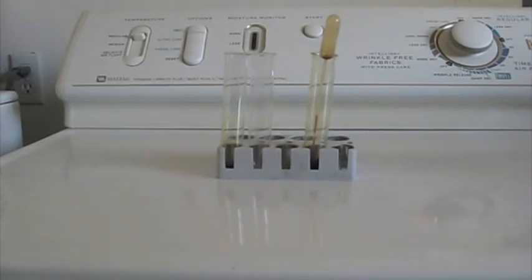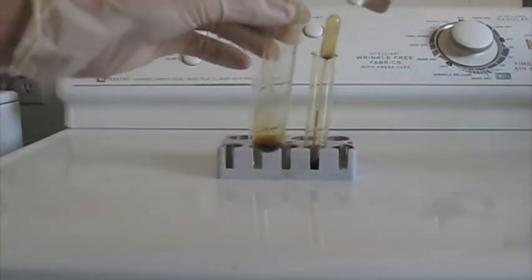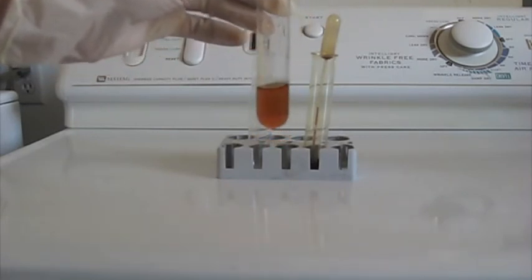Now, oops, I just tripped over the tripod. Now add about 10 milliliters of water to the test tube with the iodine alcohol solution.